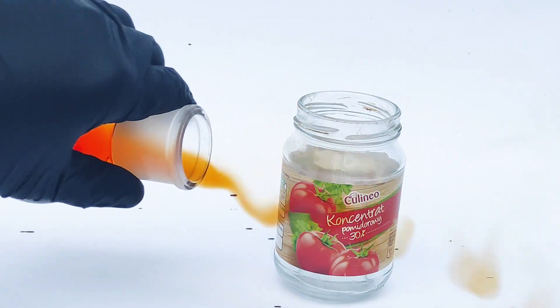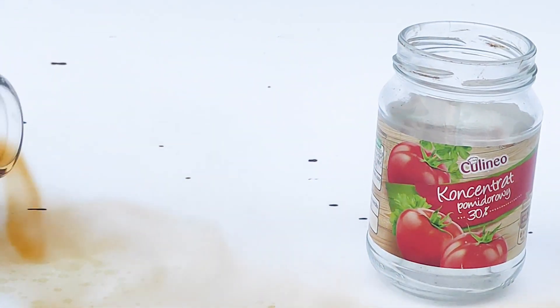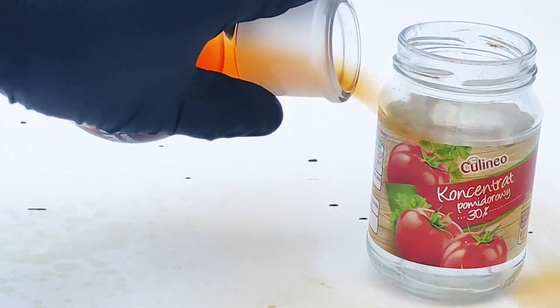Bromine vapors are heavier than air, and when I've put them on my backdrop they seemed to have reacted with something and made it visible.